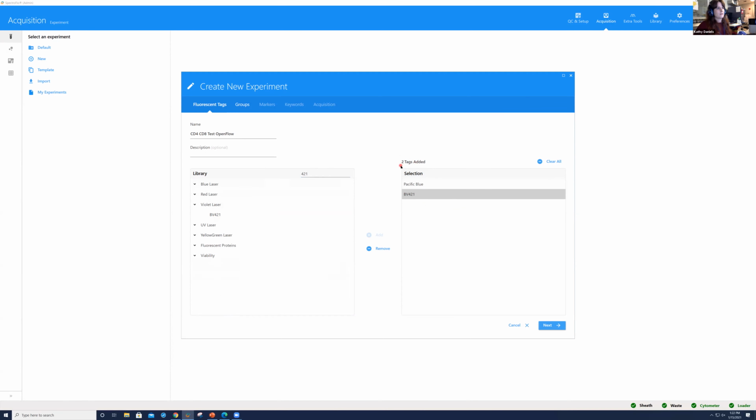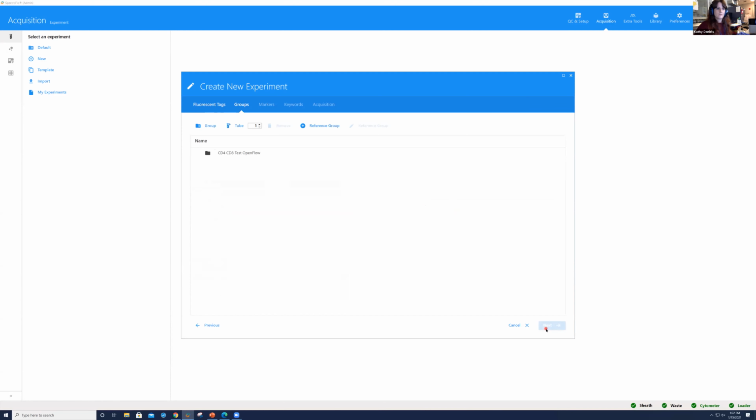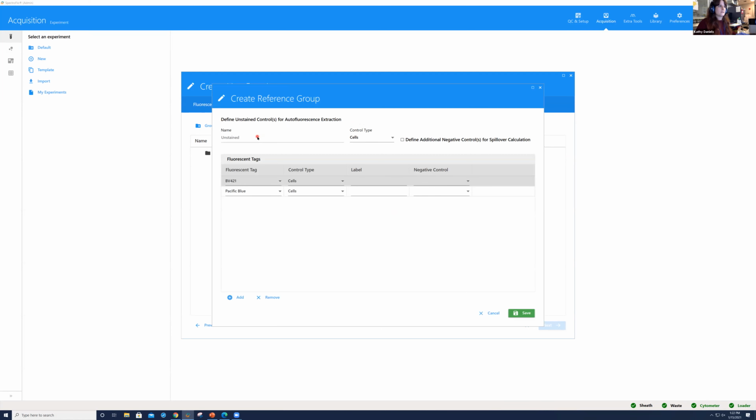And I like that we can do a quick quality check to make sure that all of our fluorochromes have been added, because it gives you the cumulative number right there. Okay. Go ahead and go to next. And again, some of this is a review from our previous session, which you can find on our YouTube channel, which is OpenFlow Cytometry. But what we're going to do here first is we're going to add our reference group. Okay. This is going to be where we're able to define our unstained control and also our single color controls, which are reference controls.